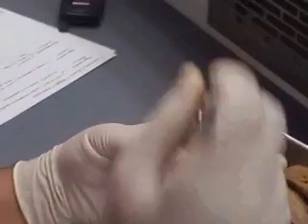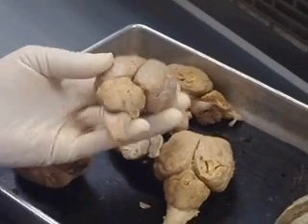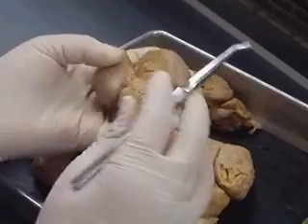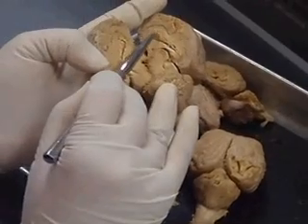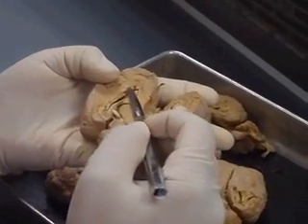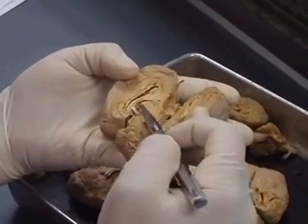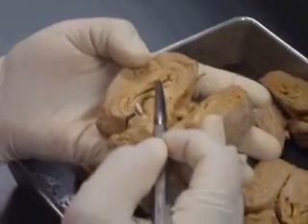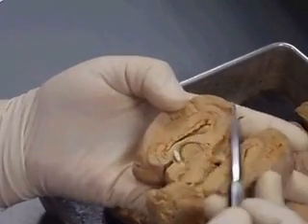There's a hole right there and that's how it starts — that's what they mean by continuous with. This is our central canal right through there. The fornix is the lower part. That's the corpus callosum, and this is your fornix. Thalamus — fornix.